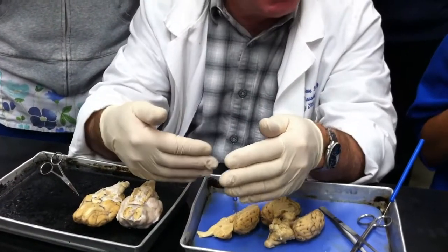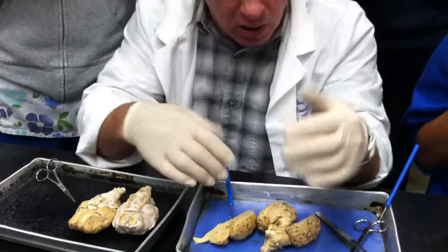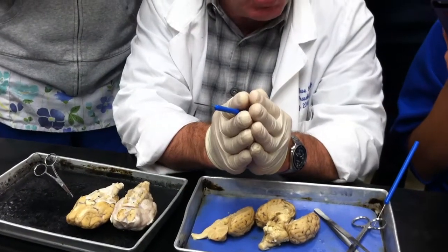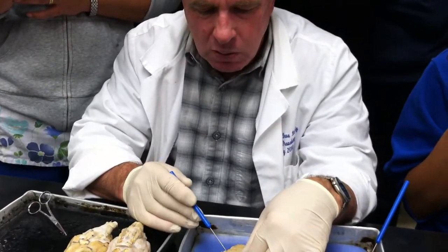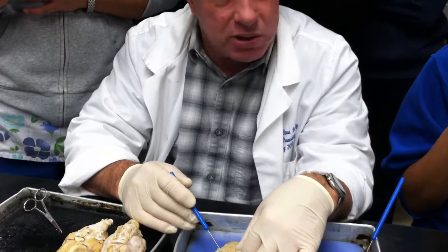So when we cut it, it's like, oh, where'd the third ventricle go? It's gone, because you sliced right through it. So here's the thalamus, there's the thalamus. The space in between when they were together was the third ventricle. So it's a little difficult to say what that is. It's the thalamus. Oh, no, that's wrong. That's the third ventricle. No, it's not, it's the thalamus.